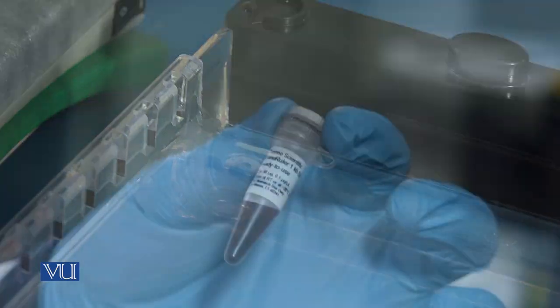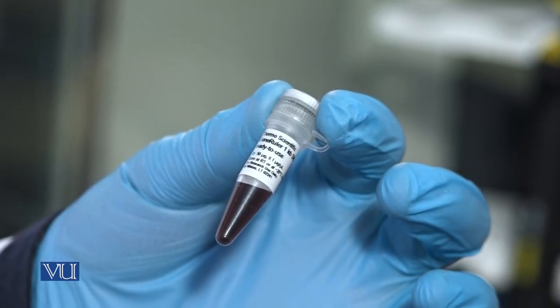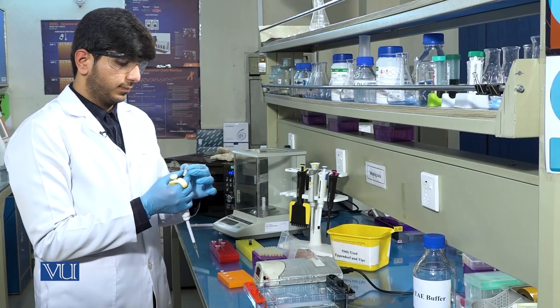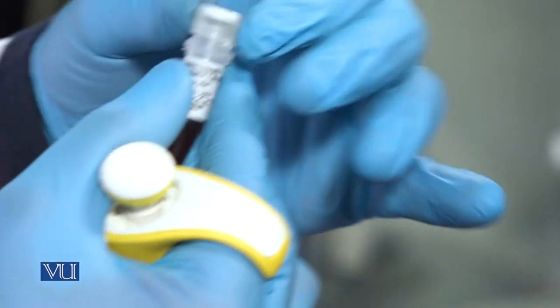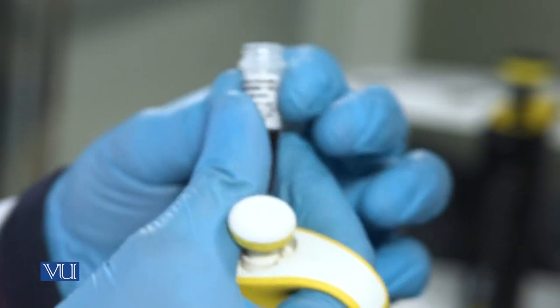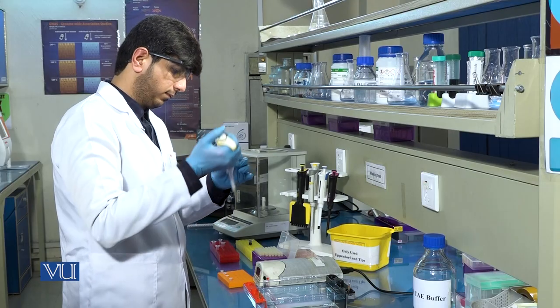In first well, you will load the DNA ladder in order to quantify the size of DNA.